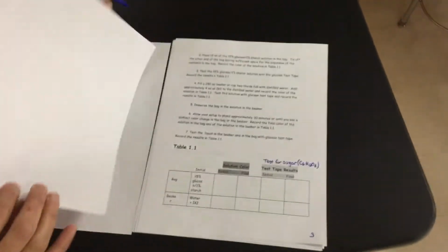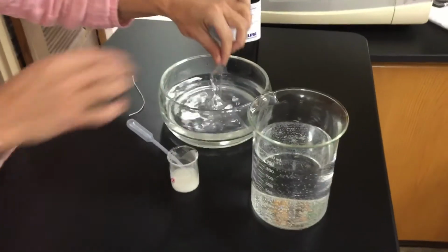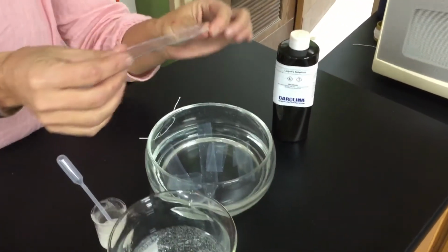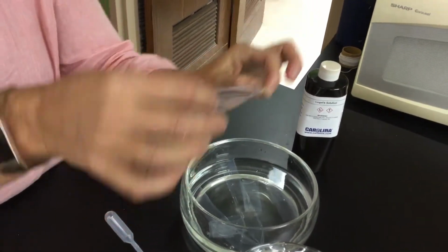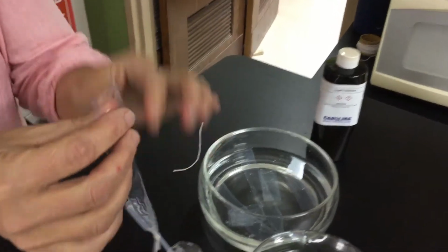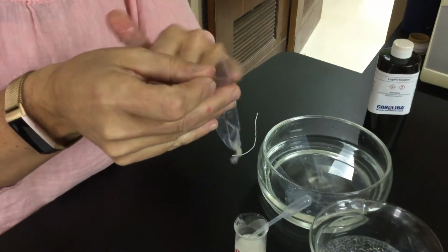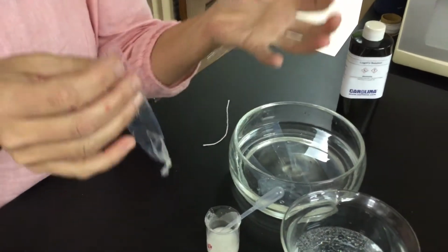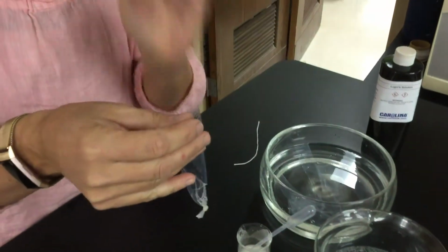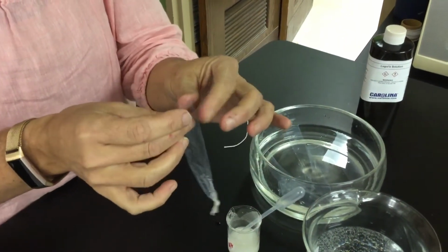If we're looking at that first part, we're going to be utilizing something called dialysis tubing, and this is something you guys may have seen in first year bio. It's very similar to a selectively permeable membrane, so it almost looks like a little sandwich baggie. I placed it in water to make it a little more pliable. I've already tied off one end of it, so now it is like a baggie. I can buy dialysis tubing that has larger openings or smaller openings, kind of like a selectively permeable cell membrane, so it allows certain things to pass back and forth through it. That's what we're going to look at: what can move back and forth across this particular membrane.